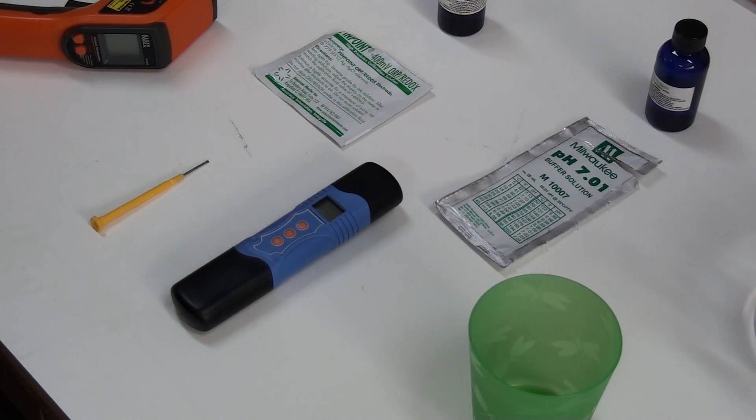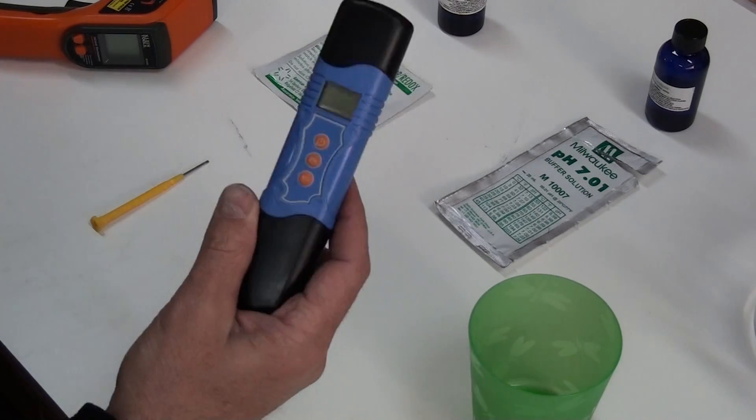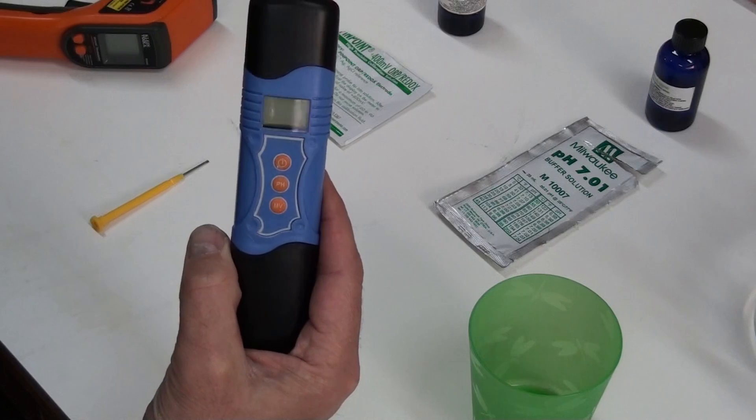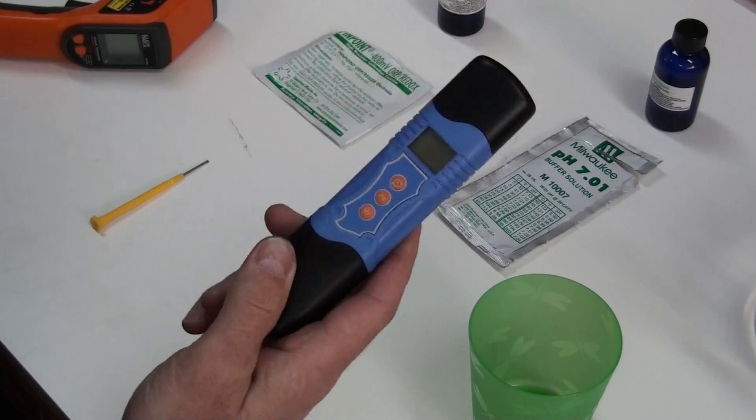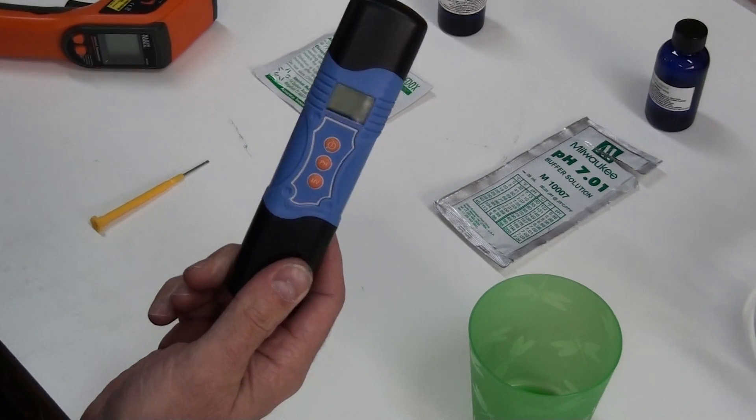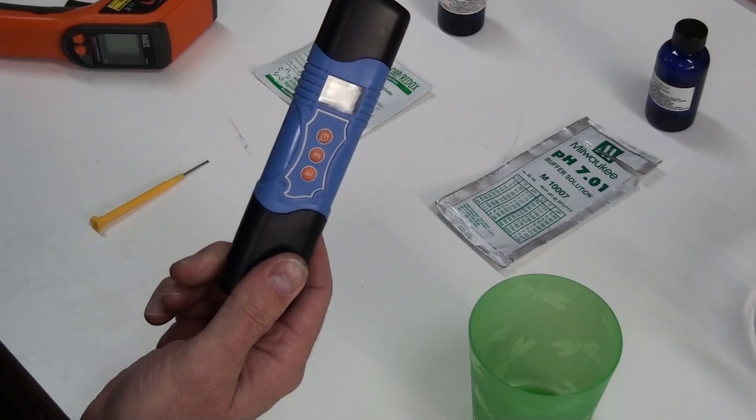Hello, this is Steve at GreenFuel H2O.com. Today I'm going to show you how to calibrate a pH and ORP meter. This meter I just got so we have to do a calibration to make sure it's accurate.